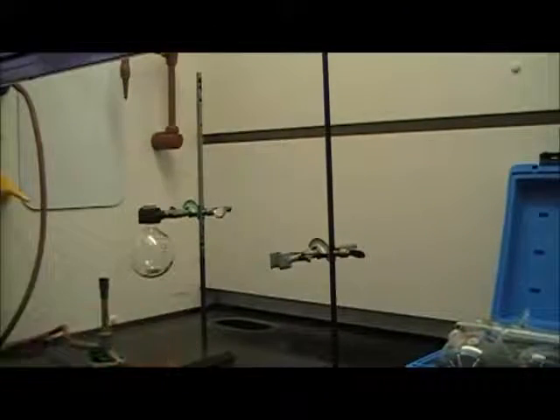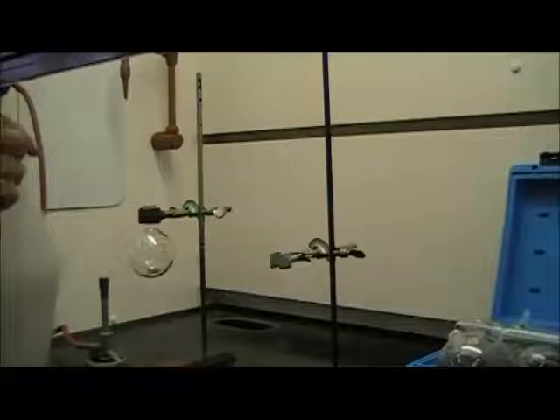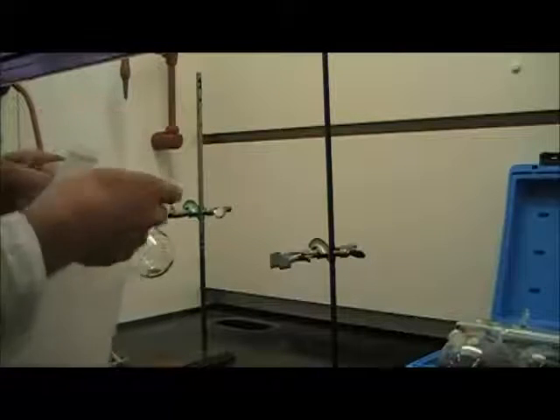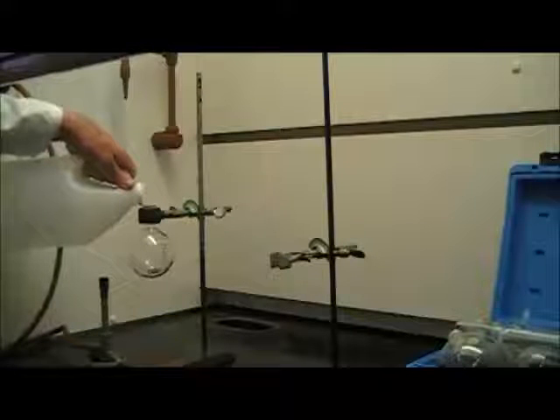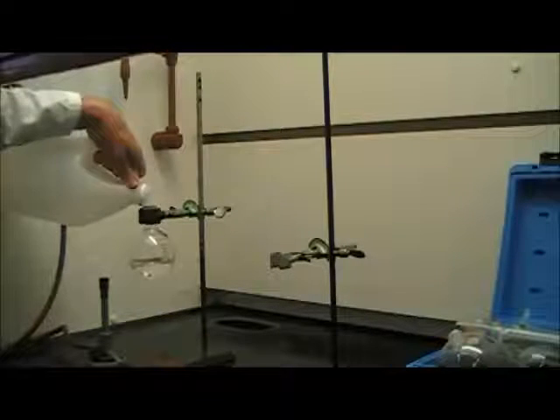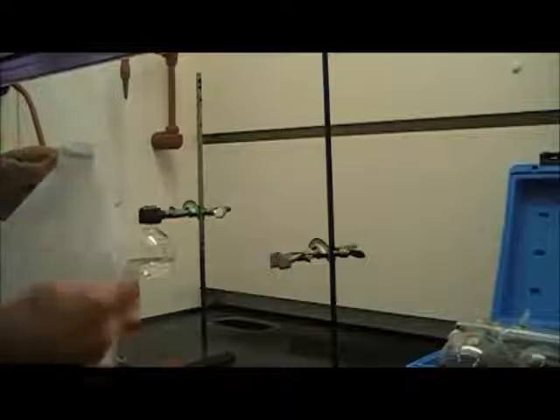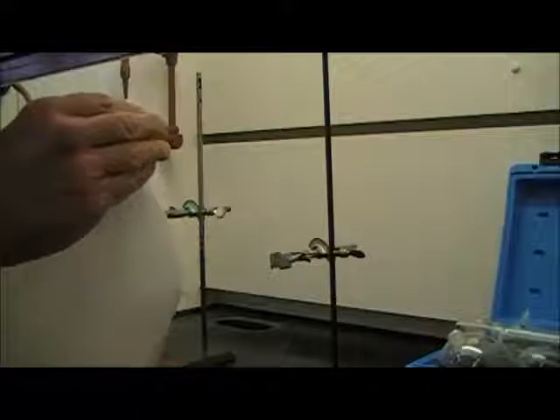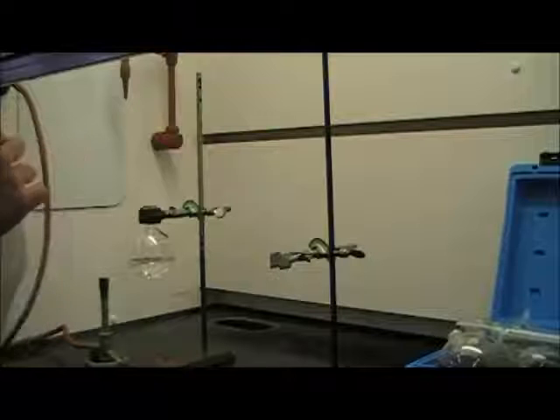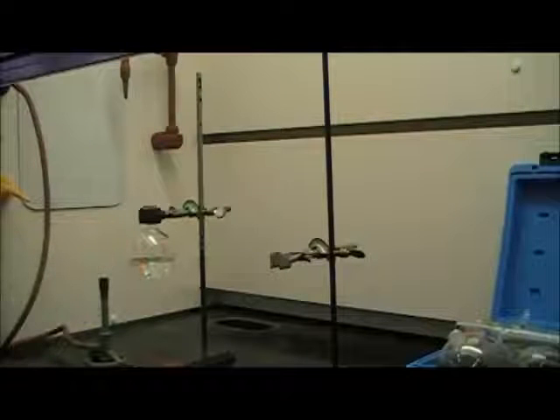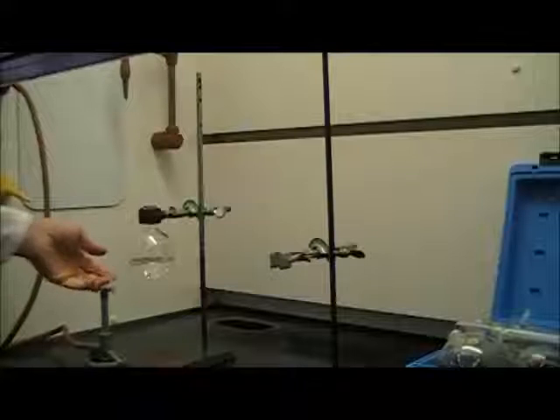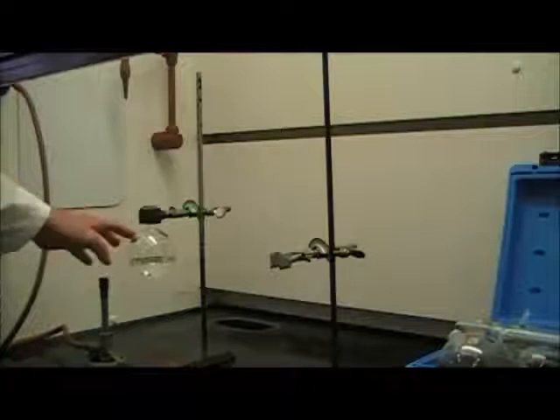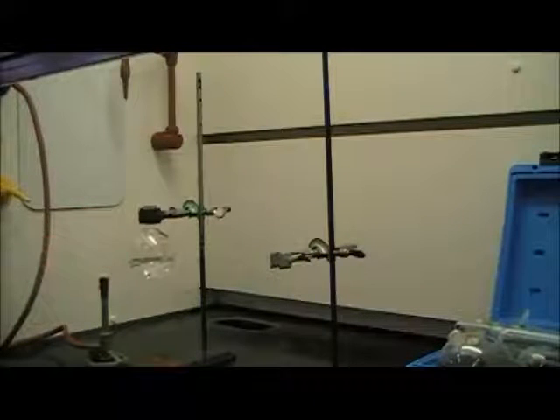So let's add some of the material that we're going to be distilling. In this case, I'm just going to distill some vinegar. I'll just pour some vinegar in here. Now, as a general rule of thumb, you don't want to have your distill pot more than half full. So since this happens to be a 250-milliliter round-bottom flask, you don't want to have more than about 100 milliliters of liquid. And that's clearly less than half, so that's fine.